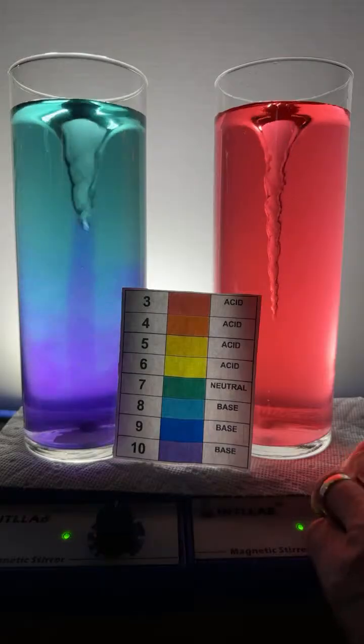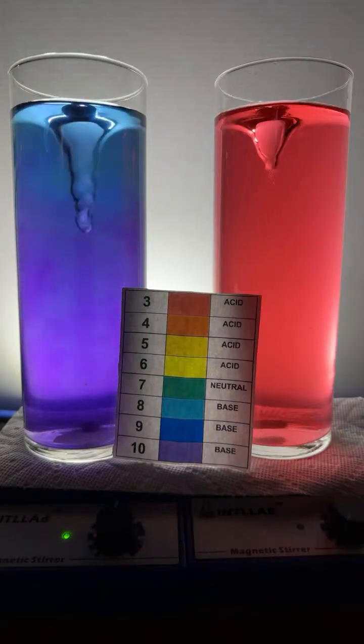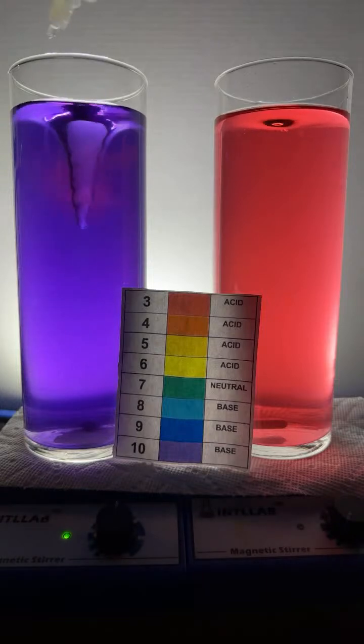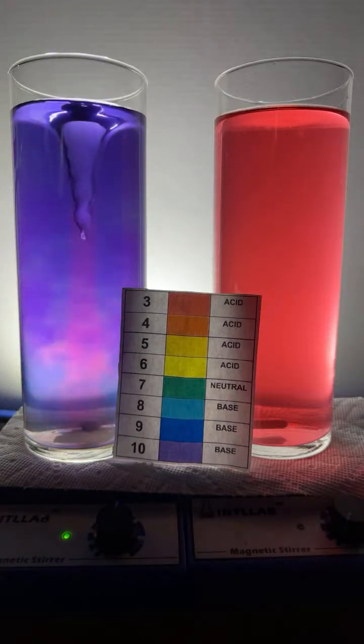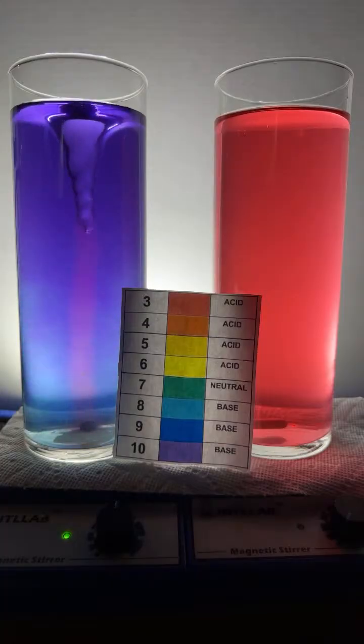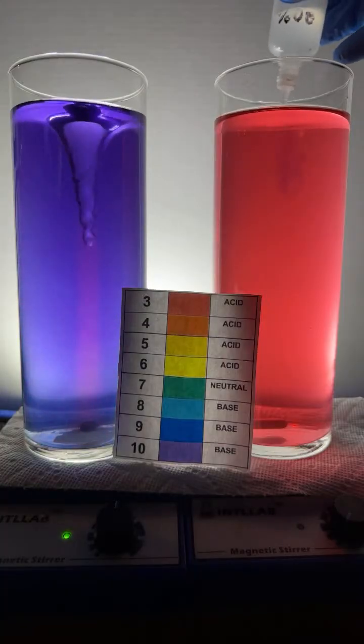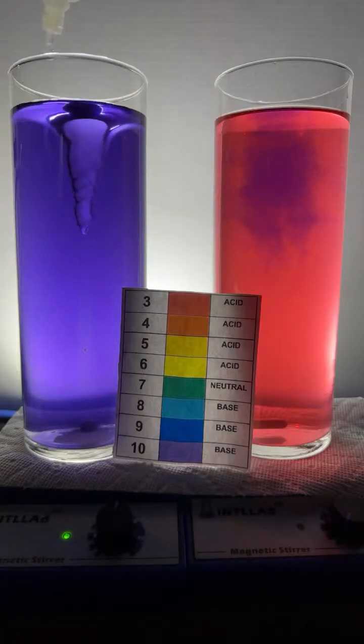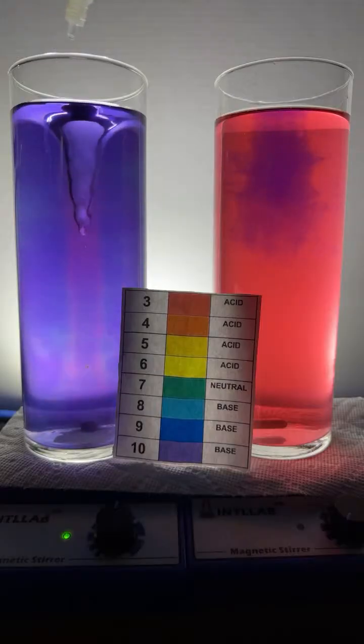All right, let's cut this off over here. And I'm going to try to add some base over here. This time I'm not going to try to add quite so much. I overwhelmed it with base. How you doing there, Abigail? All right, let's add like 2 drops this time and see what happens. So I've added 2 drops of base over here, and we've kind of cut the stir bar off. We're going to add a few drops of acid over here on this side.